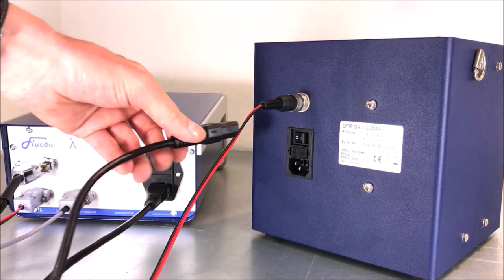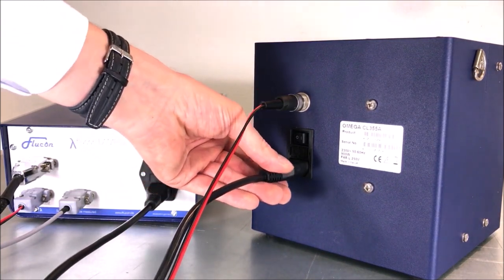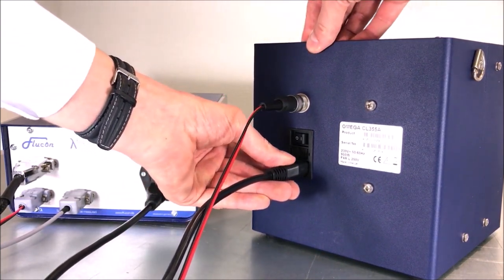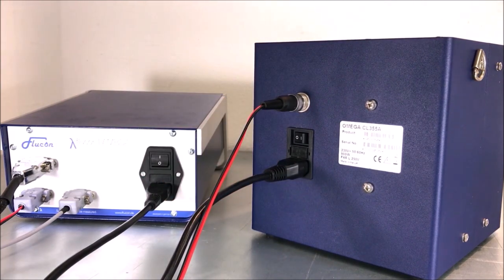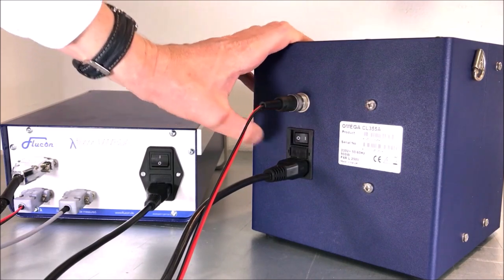Last, plug in the mains cable of your thermostat. You can now switch on the thermostat as well.